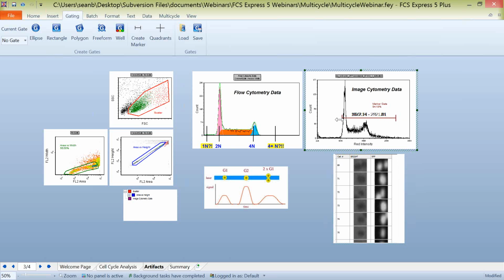And again, you can do this at a kind of basic level by creating a marker gate or creating some sort of gate on your image cytometry data and say, let's only look at the data that falls within this particular section. And when we do this, we can see that we have nice kind of single cells that aren't overexposed or underexposed, which we can be using for our cell cycle analysis down the line. So again, artifacts are one thing that you should be thinking about and taking into account when you're working with this data within FCS Express and using mathematical modeling.